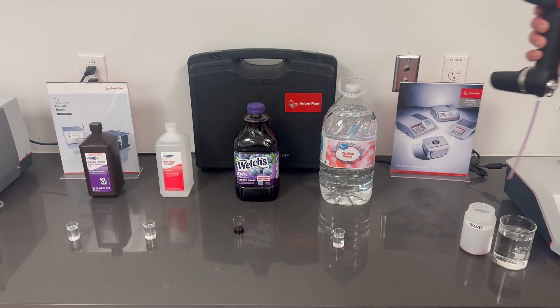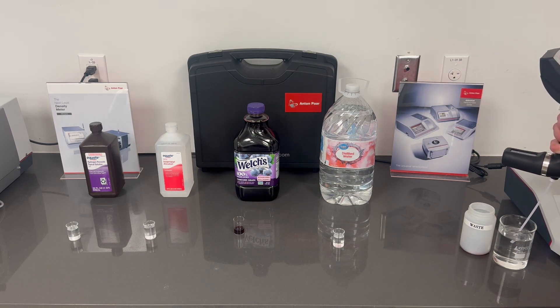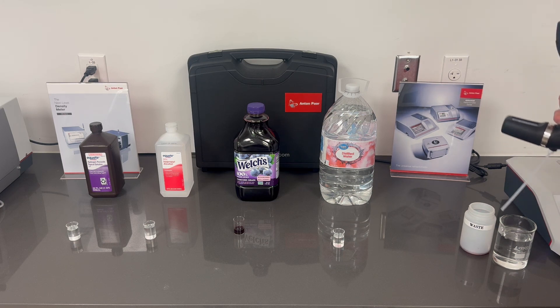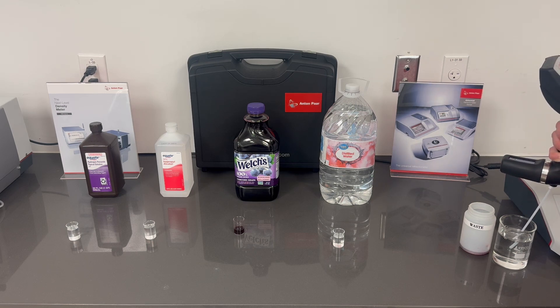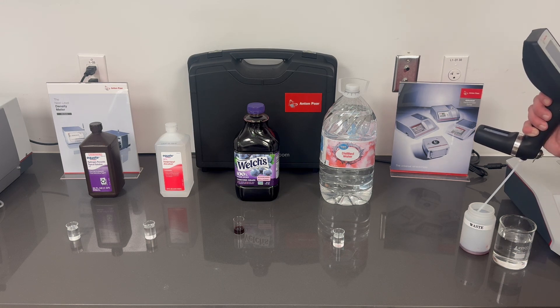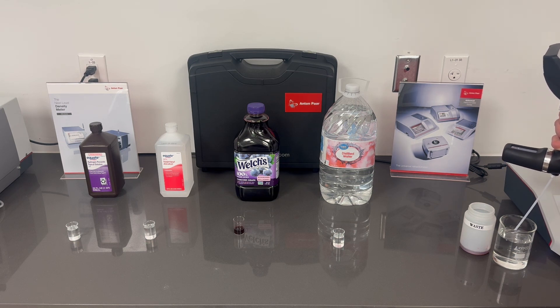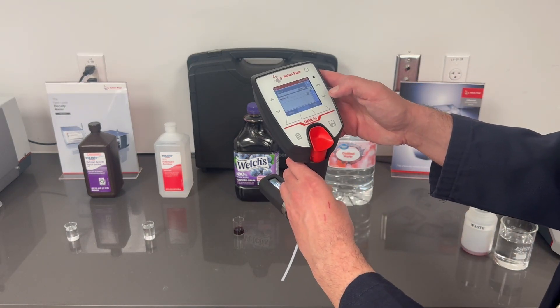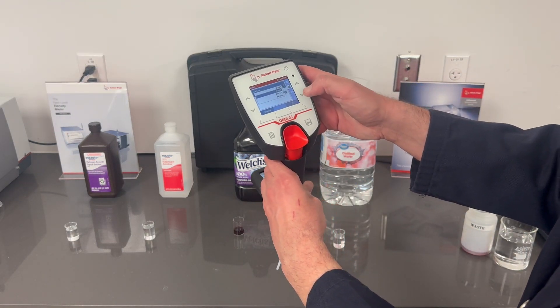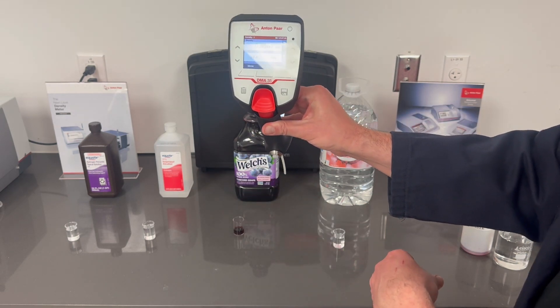We'll go ahead and rinse our device using distilled water and make sure our density is right on point. The rinsing really depends on what you're sampling, but I like to do four to five rinses when changing to a different sample. We'll switch back to density and see what we're at — right on point where we should be.